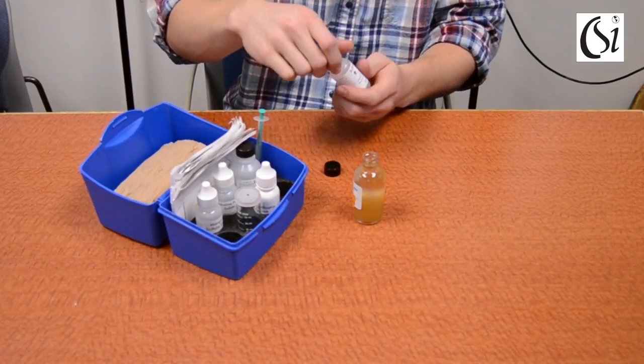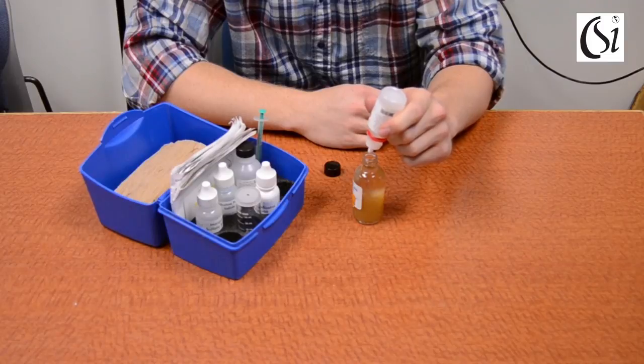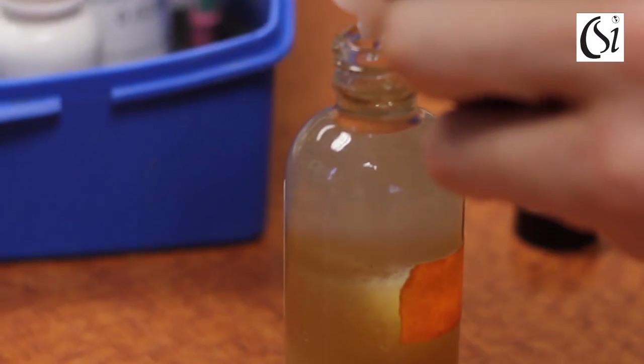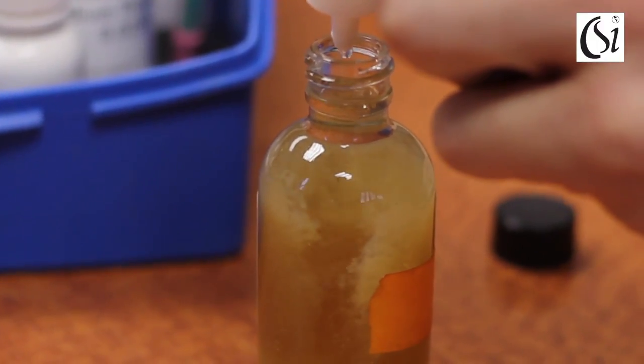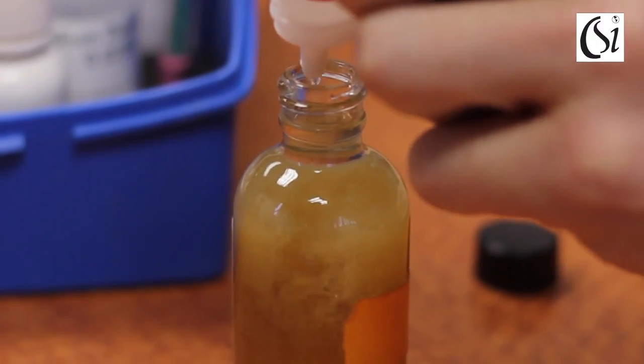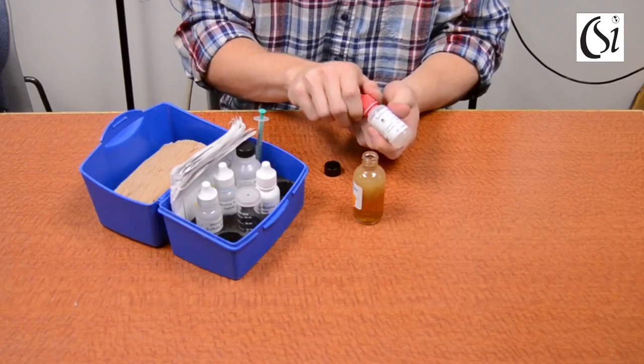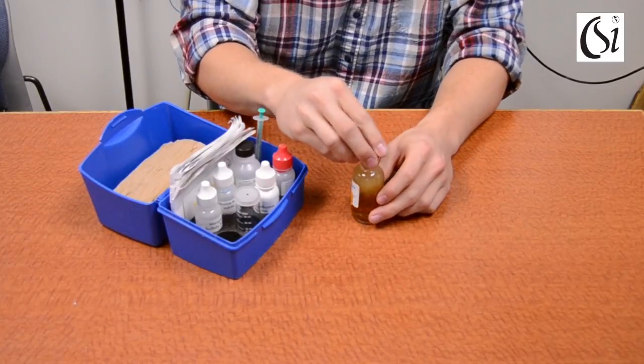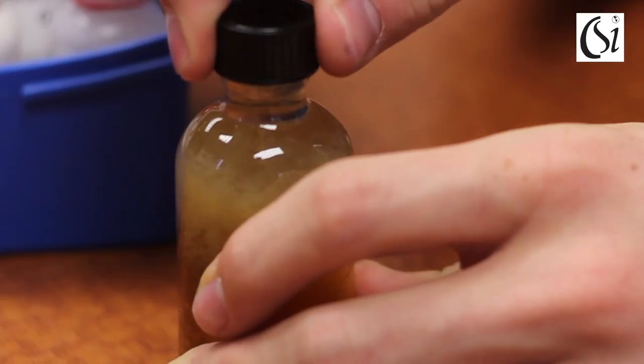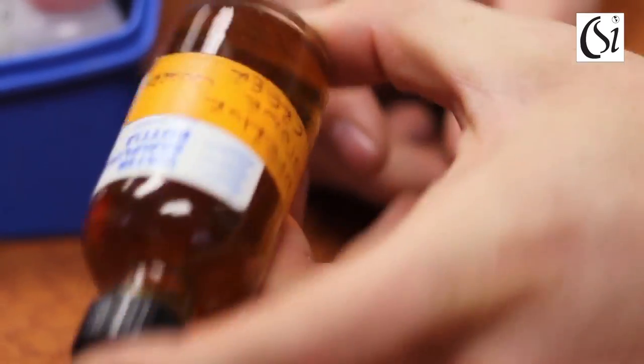Add 8 drops of sulfuric acid. Replace the cap and invert the bottle to mix until all of the precipitate has dissolved. This may take up to 30 minutes, especially when the water is cold.